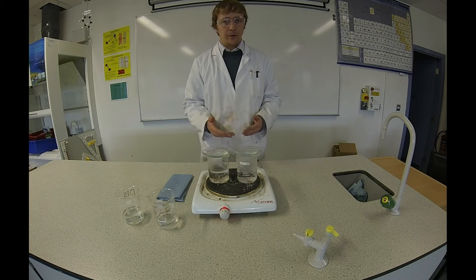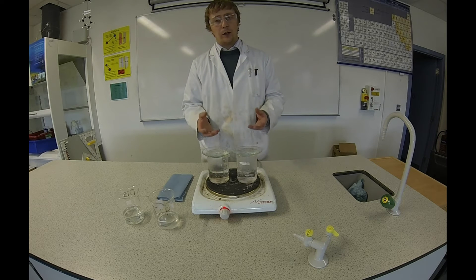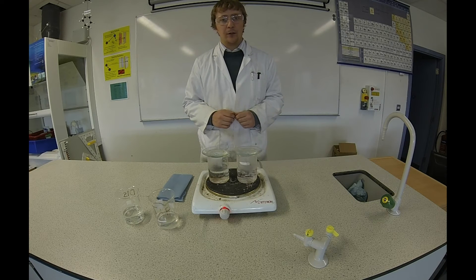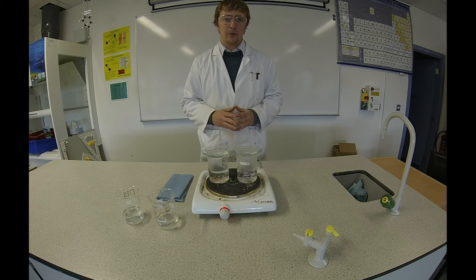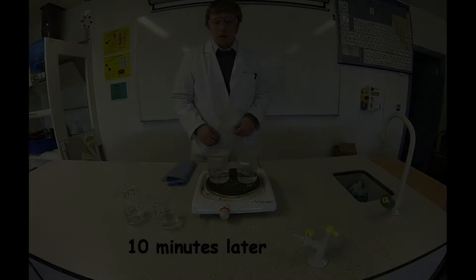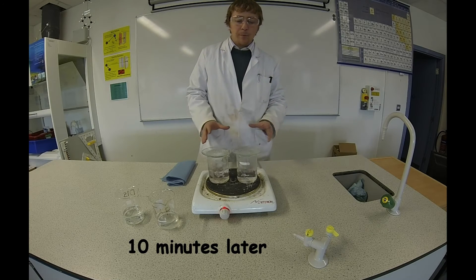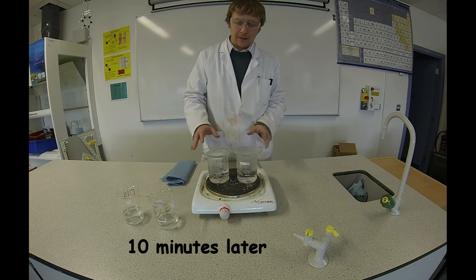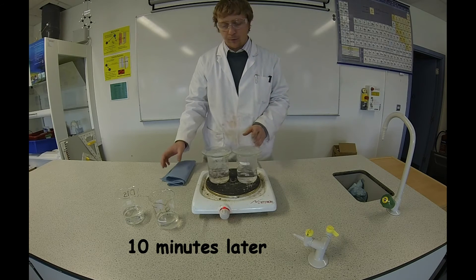It might take about 10 or 15 minutes for all the water to evaporate. We'll come back and have a check on them in a while. Okay, so these have been boiling for the last 10 minutes and all the water has evaporated from each one.